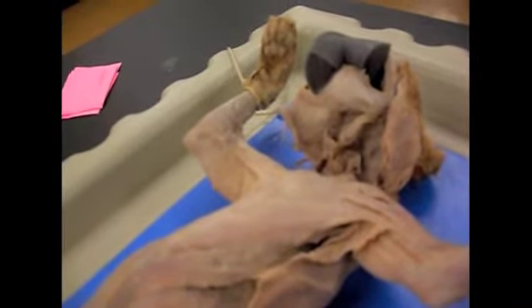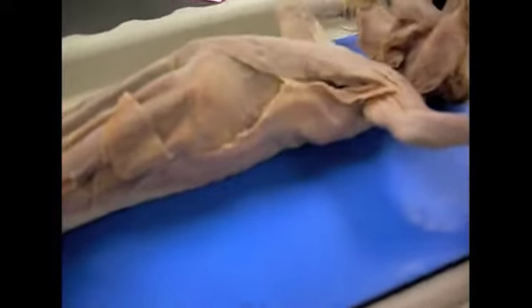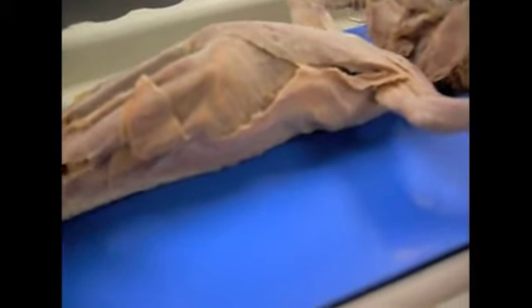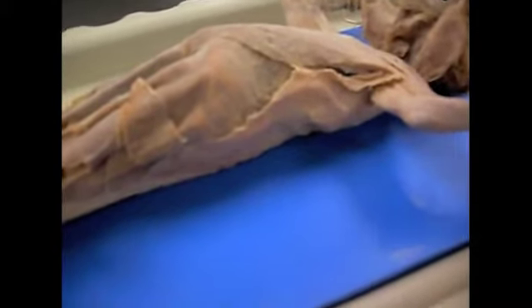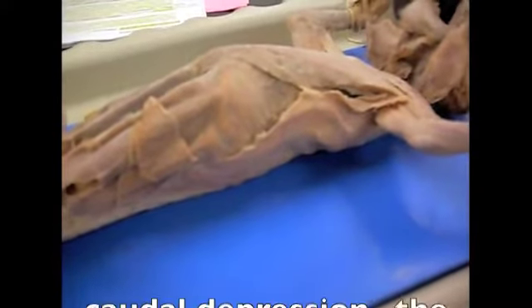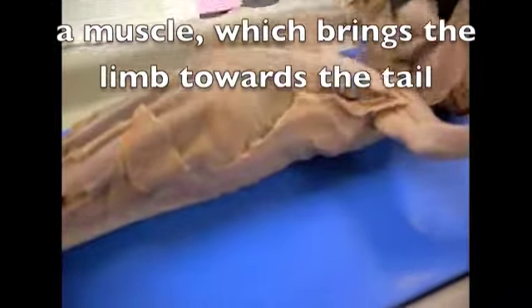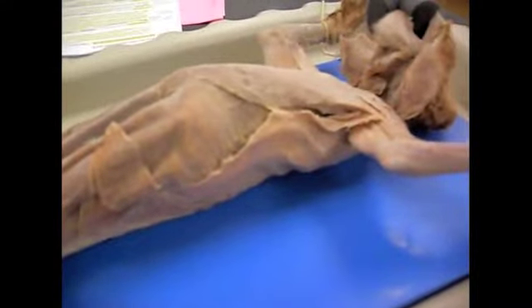Lastly is the latissimus dorsi, which is this muscle right here. This originates from the mid-dorsal line, extending from the 4th thoracic vertebra to the 6th lumbar vertebra, and inserts on the humerus. And the function of this muscle is caudal depression. Congratulations, you have just passed checkpoint 1. Now we will move on to checkpoint 2.